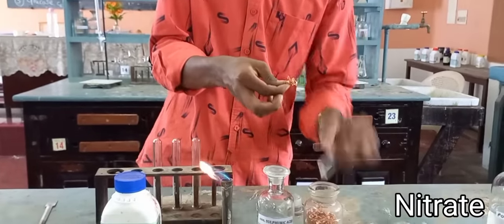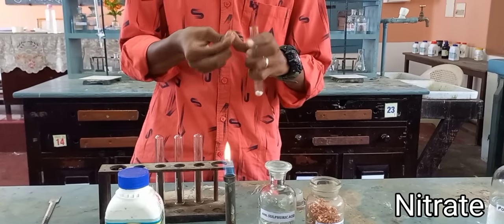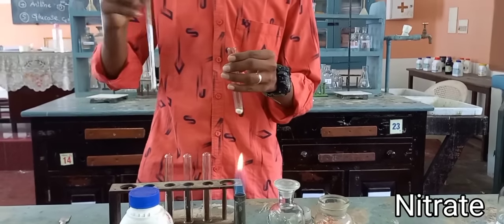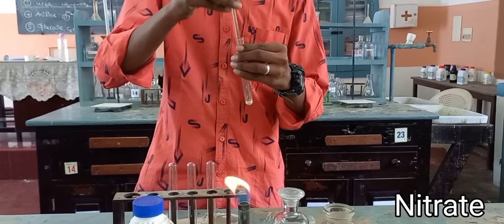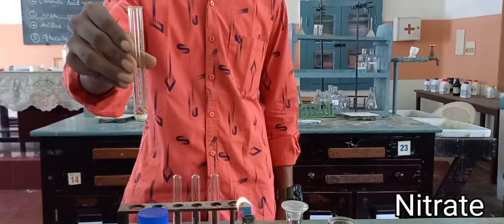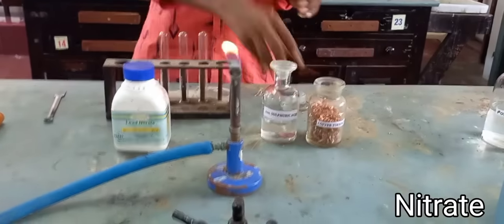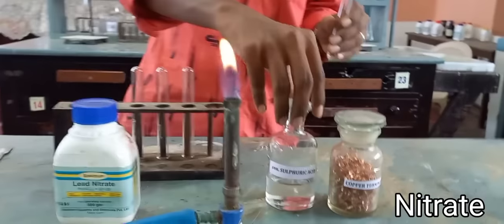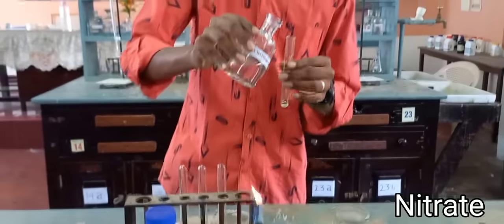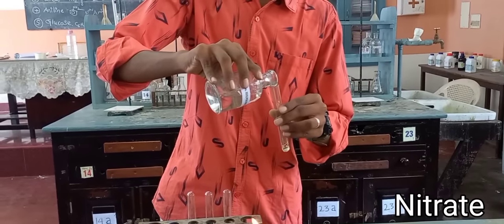Press and insert the copper turnings — use a glass rod to push it in if needed. Now we have lead nitrate salt and copper turnings. Add 3 to 4 drops of concentrated sulfuric acid to it.